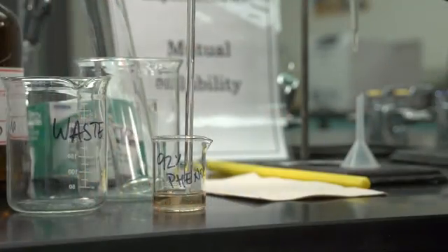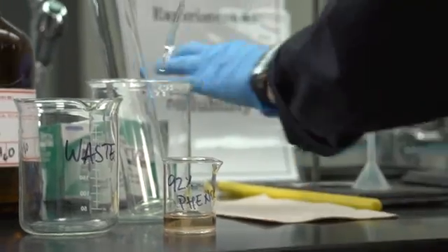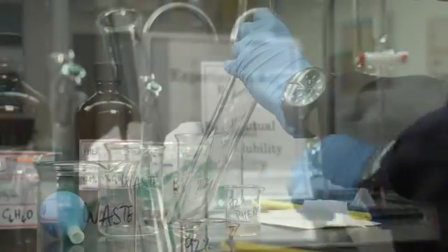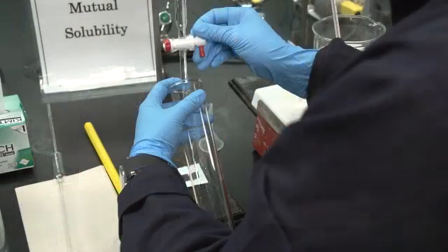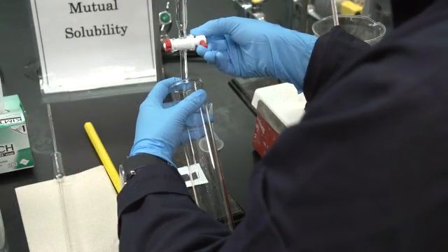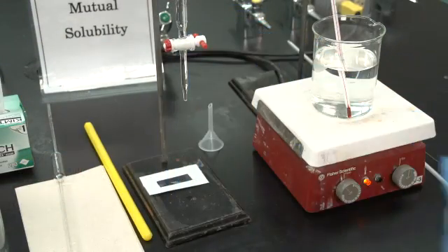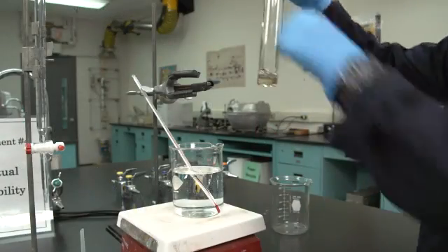Pipet 15 mils of phenol solution and place it in the freezing point tube. Add 7 mils distilled water from a 50 mil burette. Place the tube in the water bath.